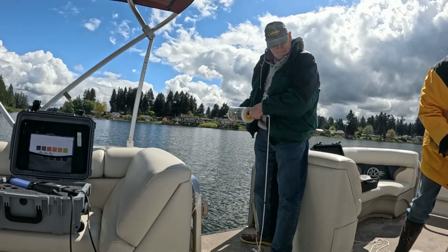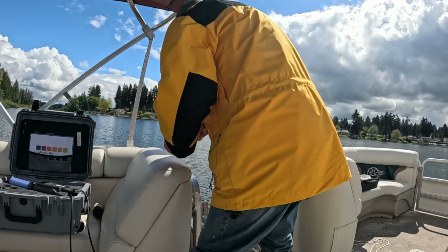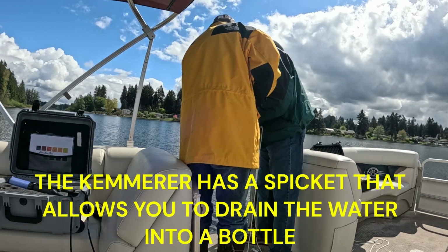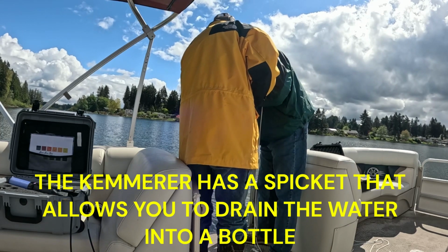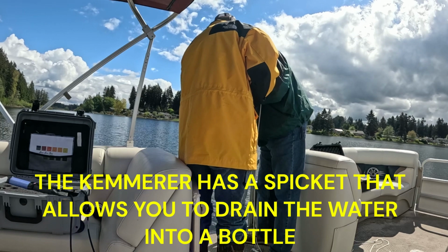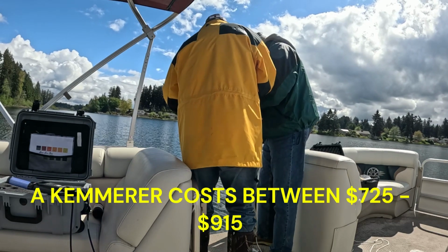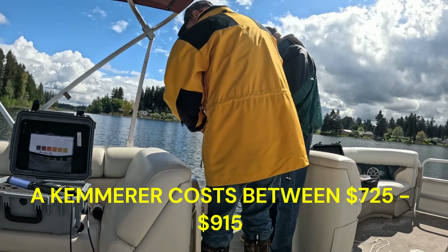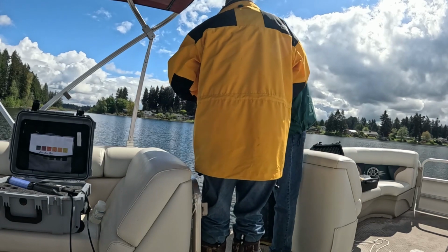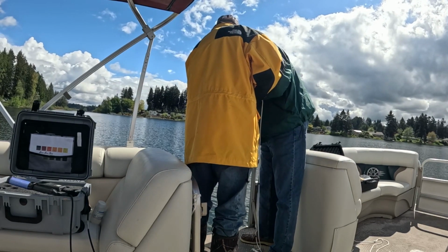Sample 3. Sample 3. And it's holding now, isn't it? Jerking it. So we're taking water test samples at 1 meter, and then just off the bottom. 2 different samples at 1 meter, 2 different samples off the bottom.